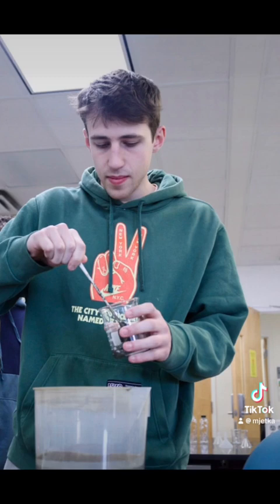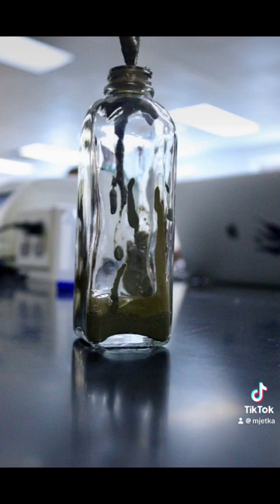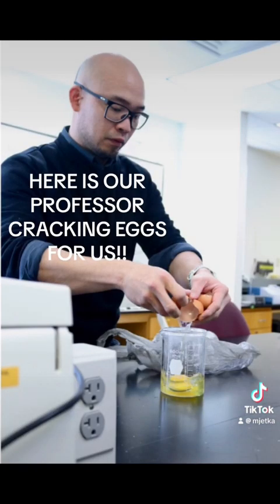Step 1. Source the sediment from the retention pond. Fill the column first with sediment and use a vortex mixer to vibrate the column. This allows for all air bubbles within the sediment to rise and escape. Step 2. Add nutrients. Mix of nutrients depending on the column.